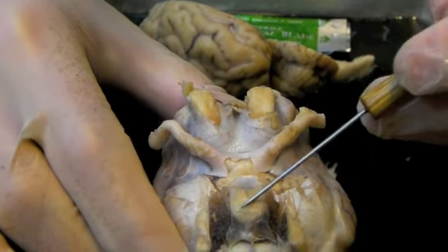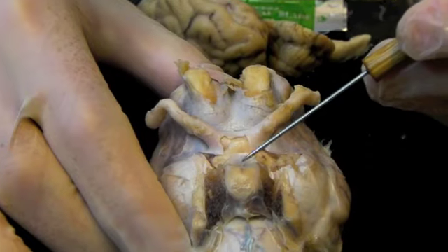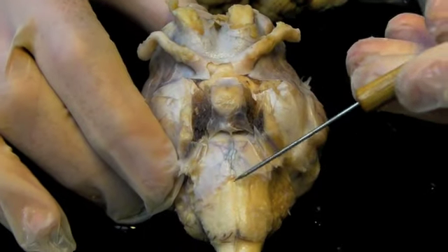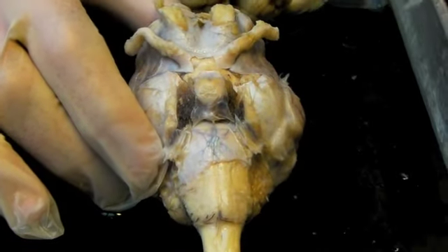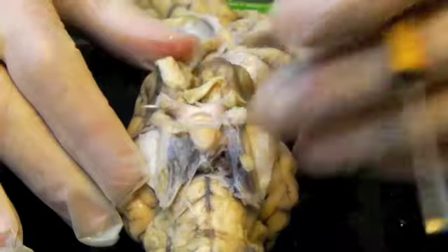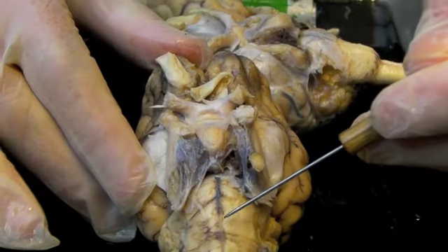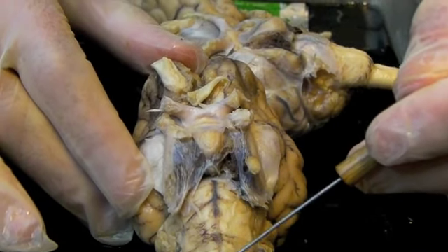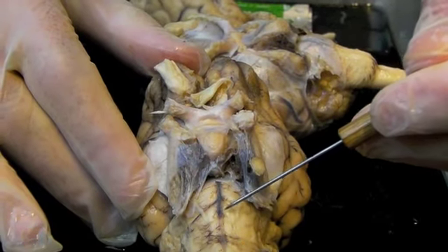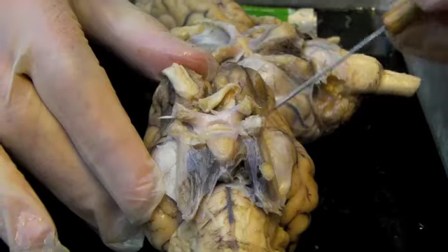Next thing here, this is your master endocrine gland, the pituitary. It's attached to the hypothalamus of the brain. And then working down, this would be the midbrain, pons area, and medulla. I want to show you something on this other specimen I have here. This shows the basilar artery very nicely. The posterior brain is supplied by the vertebral arteries, which when they get up to the brain connect to form the basilar artery, which will then connect into the internal carotid by the circle of Willis.